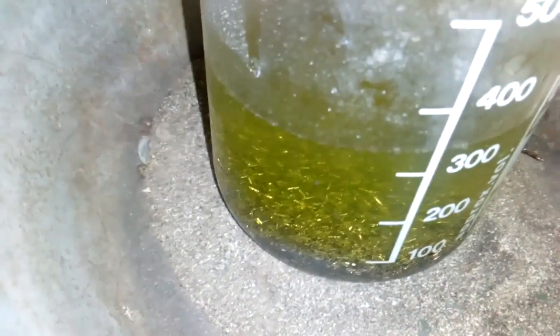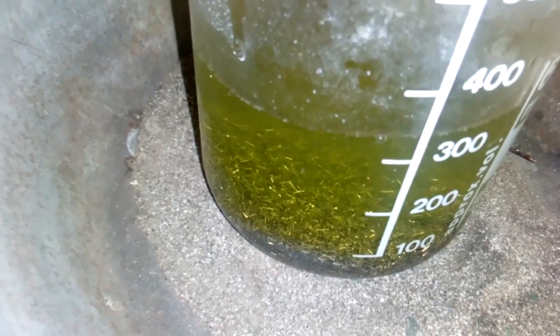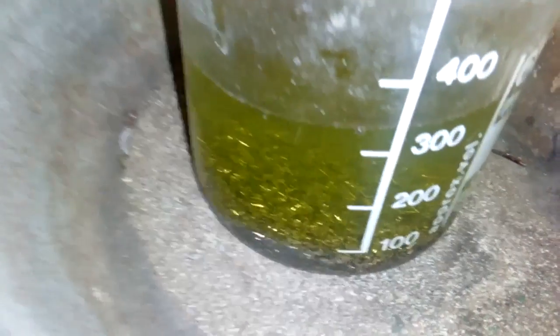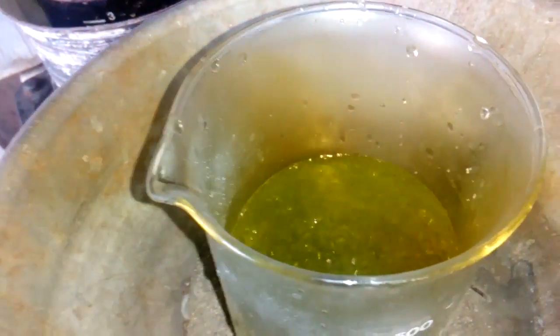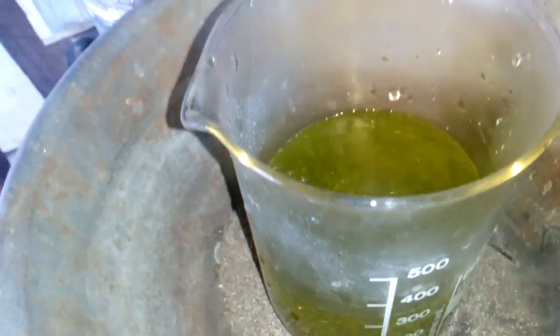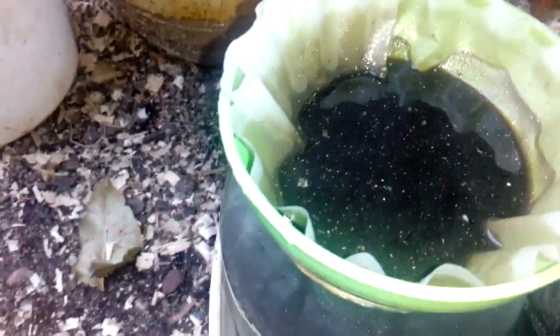After some time, we got reaction. See that bubbles and the change of color? Lots of bubbles. You got to be careful of the fumes, always wear a mask. This is our first batch. You see some foils. Those foils we will return back in our second batch.